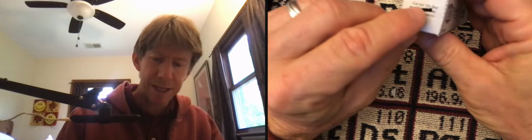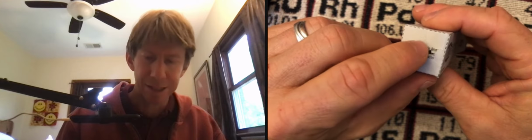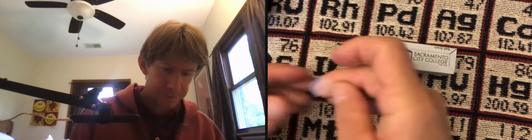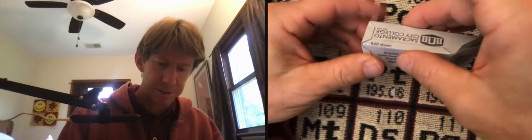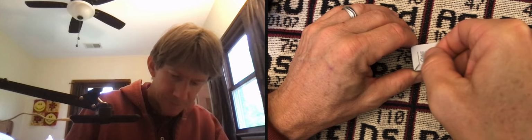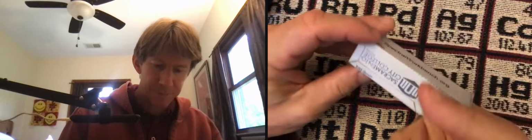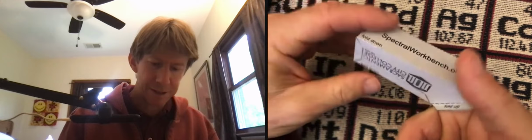And you do not want any tape going over this slit here because we want just light, and tape light would be different. And I've got, yeah, I don't have any tape there. So tape down this third side. You can stick your finger in and just tape it down and get that tape nice and secure.